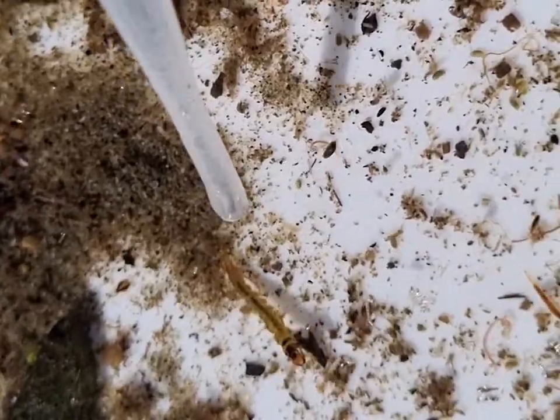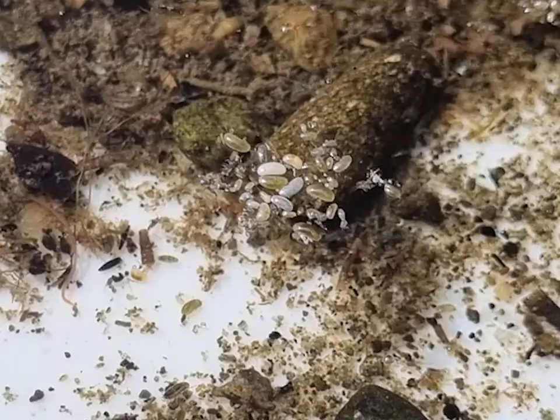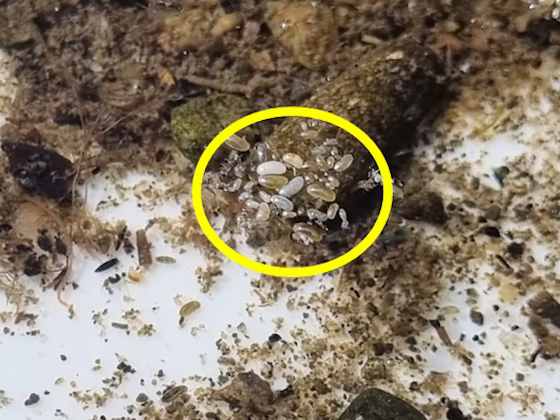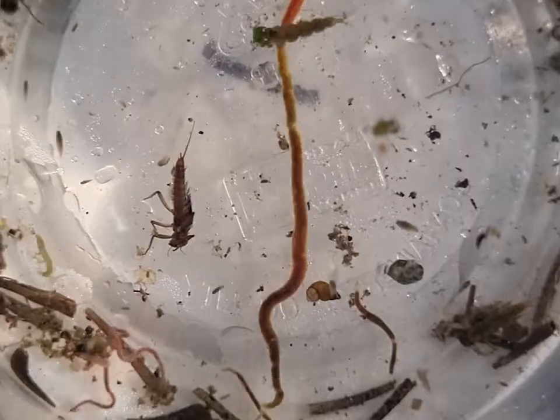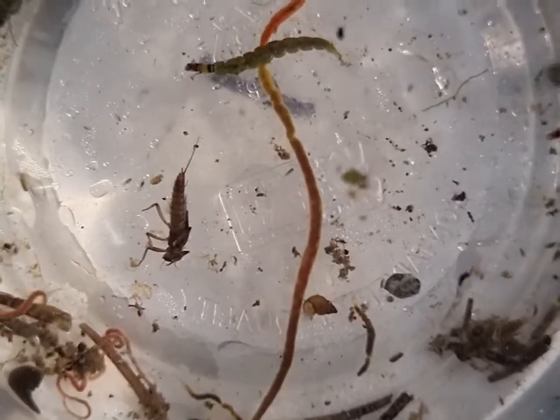However, some of these things are pretty small and they're moving around pretty quickly. You might get things like ostracods which float on the surface as shown here, but they're harder to find and see in the field, and then you're going to end up with some sort of live samples.